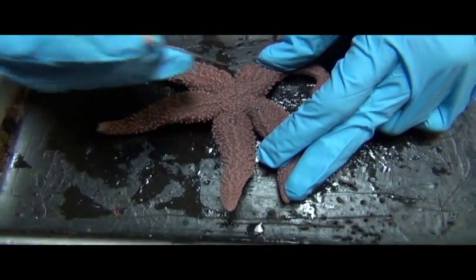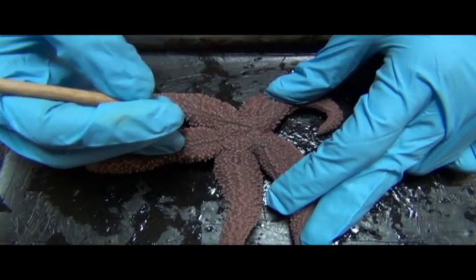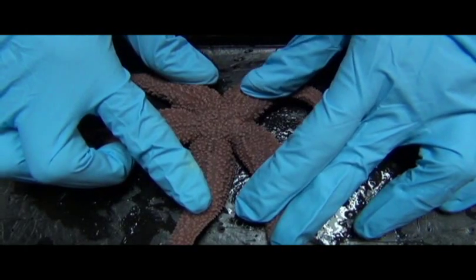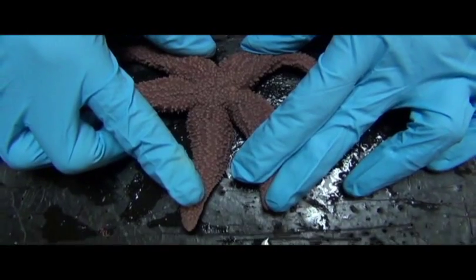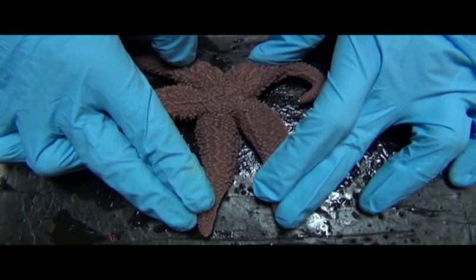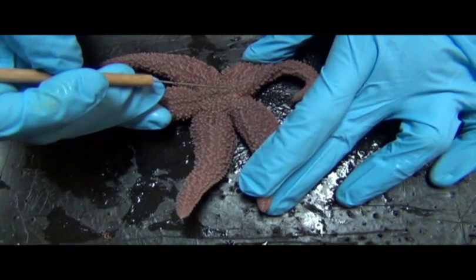Now this little dot right here, the madreporite, regulates how much water can come in and out. The more water that comes in, the more rigid or stiff this animal can get, which is important because these guys live in the intertidal zone, and so if there are a lot of waves crashing, you might want to be stuck to a rock really tightly to avoid getting pried off by crashing waves, and that's when stiffness matters.